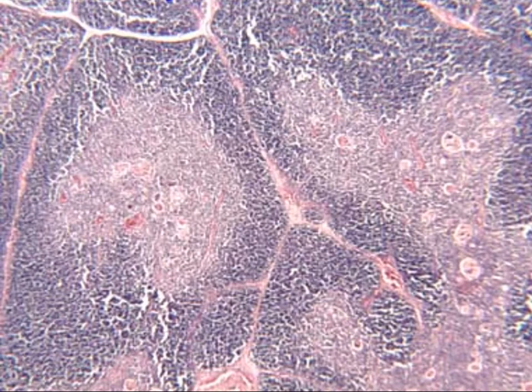Here we have now the thymus. The thymus has two different components to it as well, and so we have a cortex and we have a medulla once again. So similar to what we had for the adrenal gland. And so we have the cortex here out on the outer aspect and the medulla in the inside portion there, kind of surrounded by it. It also tends to kind of look like the pancreas did, except that in this case, since the medulla is in a sense kind of the center portion, it's also a much larger component.